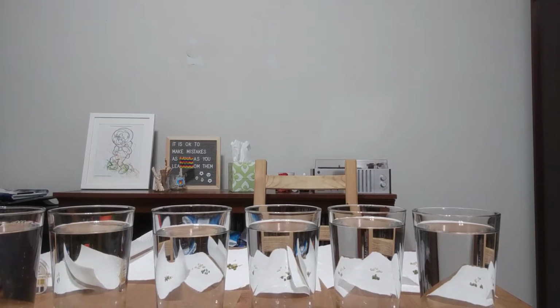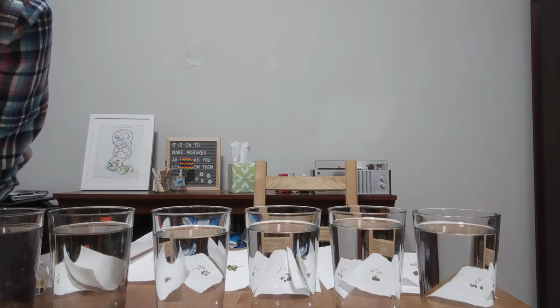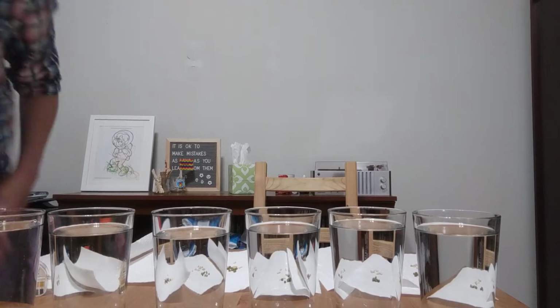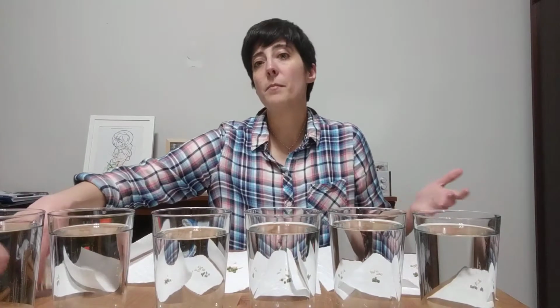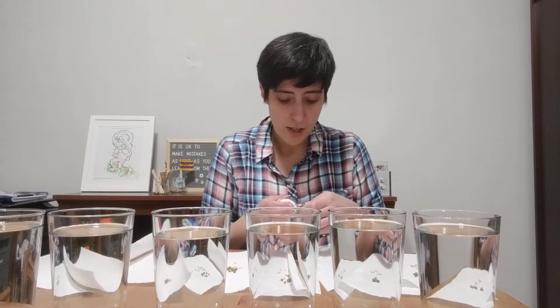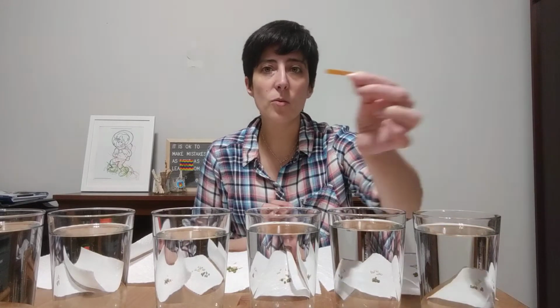Just need 20 mLs. Okay. So that was 200. All right, so now what we're going to need to do is measure the pH. I'm going to go ahead and do that before I start getting some of this onto the paper towels. All right, so first, this one is going to be the pH of regular water.